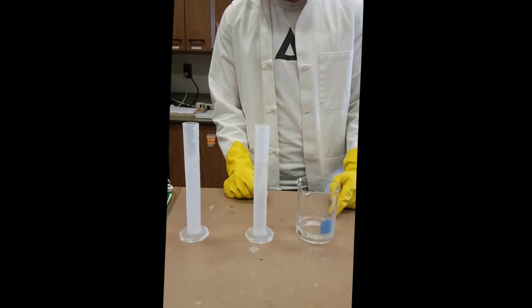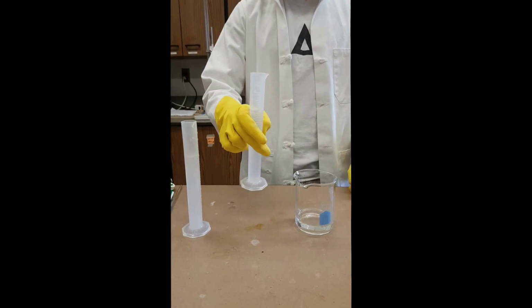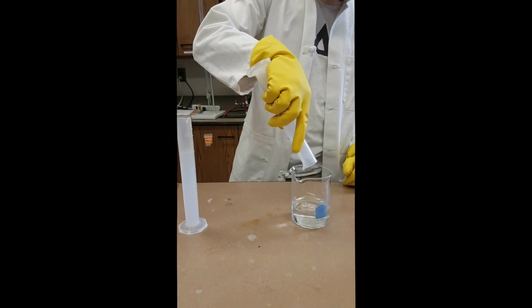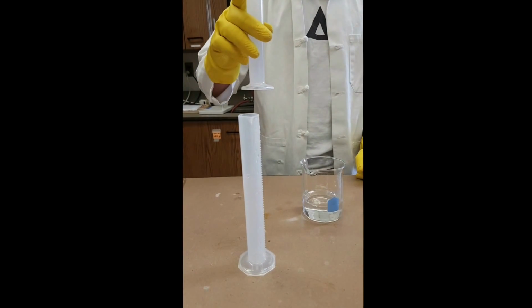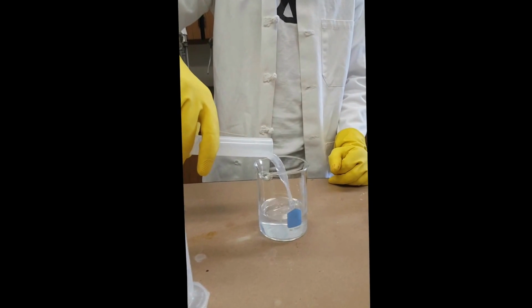So here is the 40 milliliters of 8.6% hydrogen peroxide, and here is the 0.2 molar acidified potassium iodate. 40 milliliters of this too. Gonna add it in. And finally, we're gonna add in 40 milliliters of our starch, malonic acid, manganese solution, and reaction.